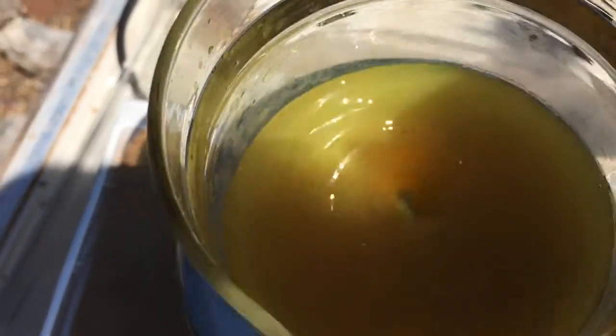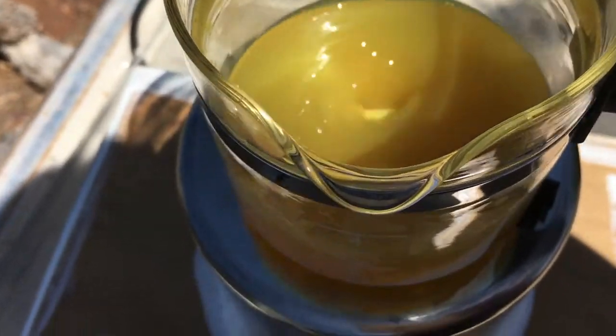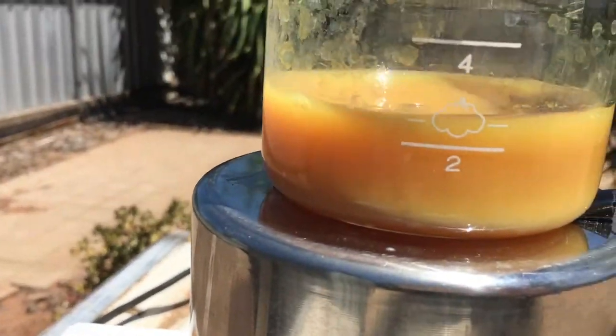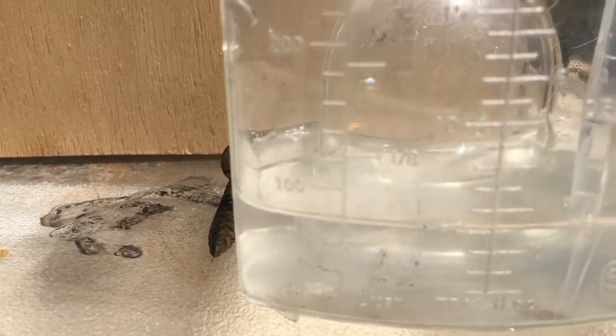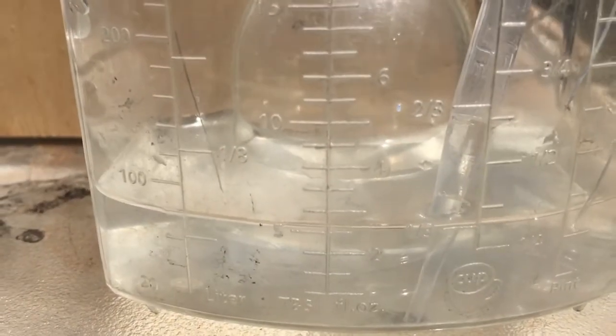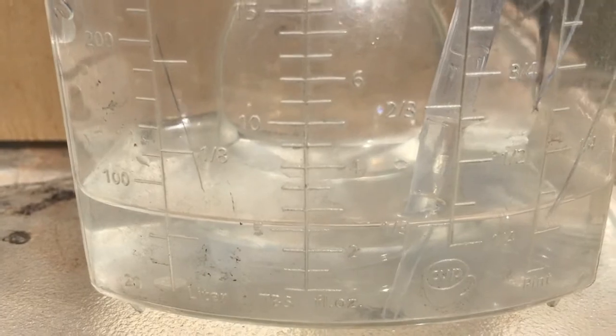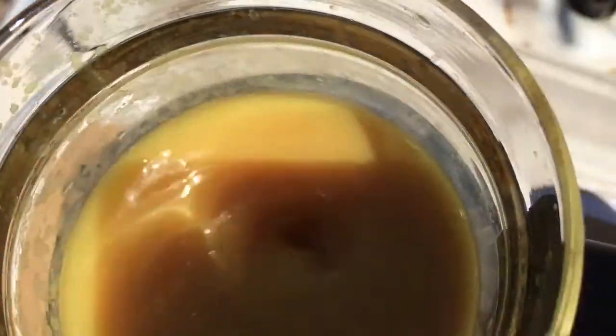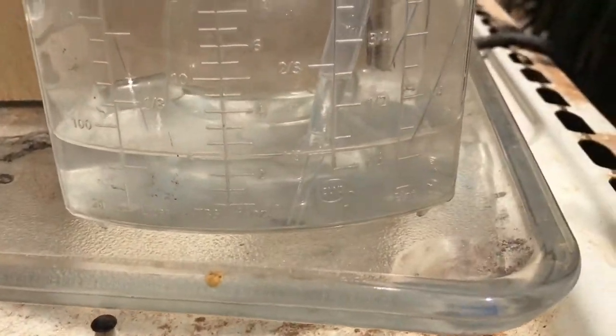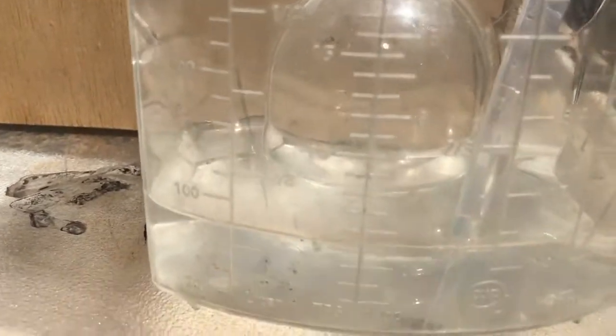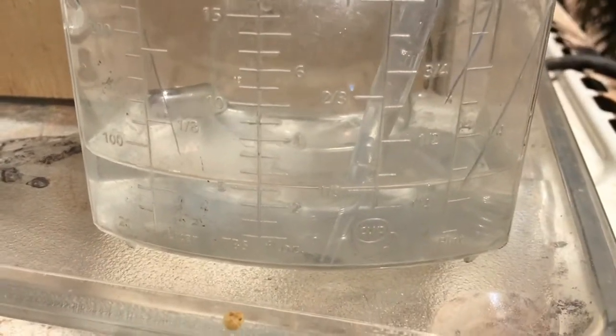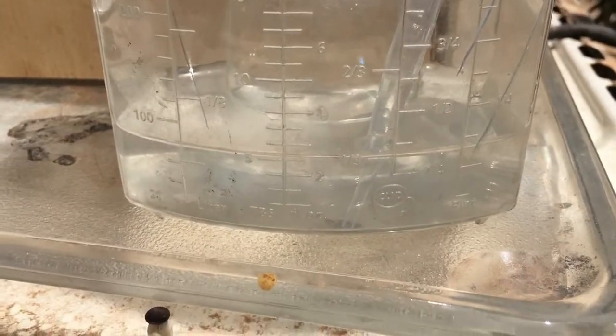It's getting thicker. So far so good. It's been one hour. I've added 20ml in one hour. I've changed the count to every 3 seconds, add a drop. It might be going too slow. I might have to pick it up though. I'll be here for another 1, 2, 3 hours at that rate.